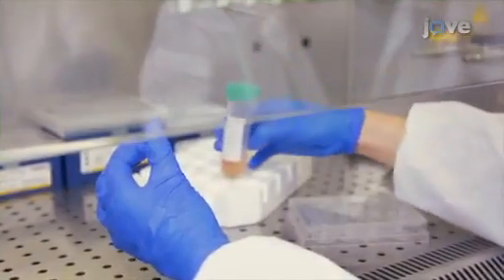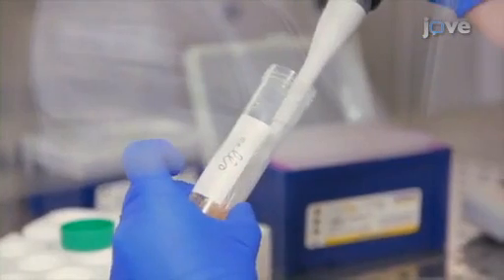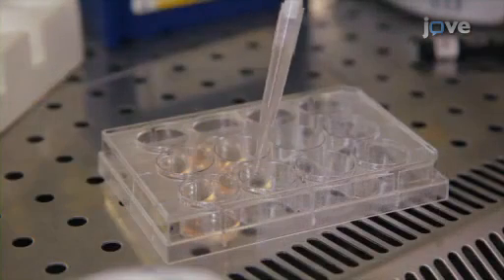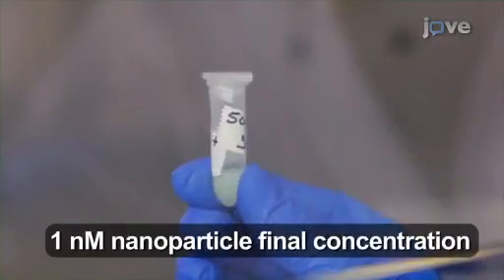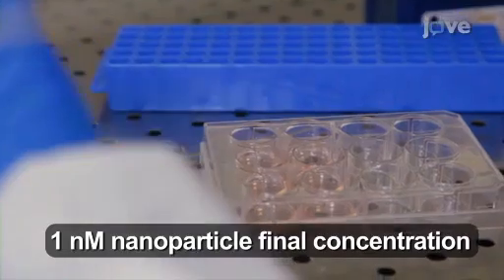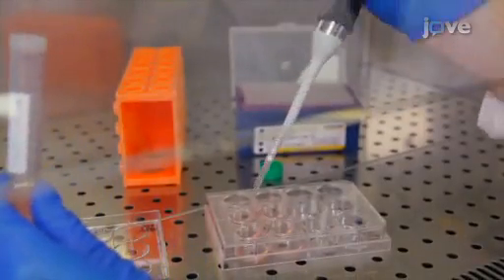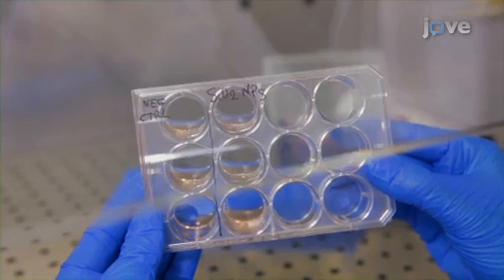For nanoparticle internalization in blood leukocytes or purified monocytes, begin by plating 5 × 10⁵ of the cells of interest in 1 ml per well, in each well of a 12-well plate. Then add 10 microliters of freshly prepared working fluorescent silicon dioxide nanoparticle suspension to each experimental well, adding an equal volume of complete medium to the untreated control wells at this time as well.